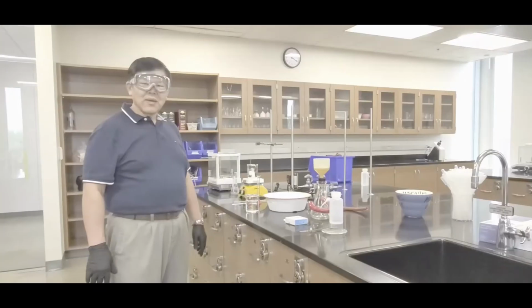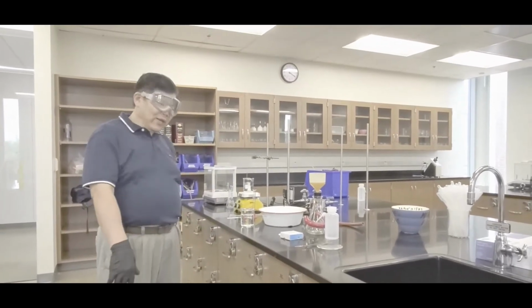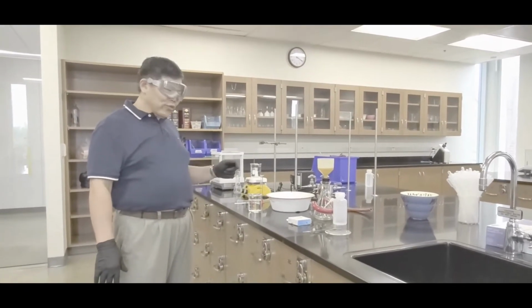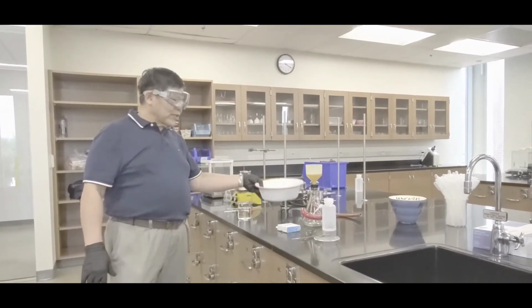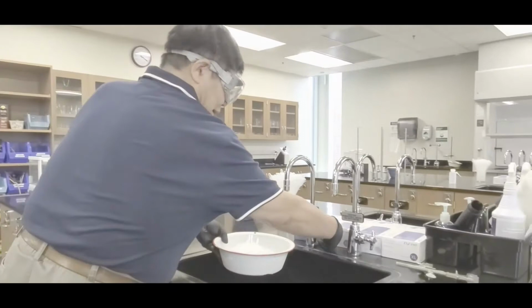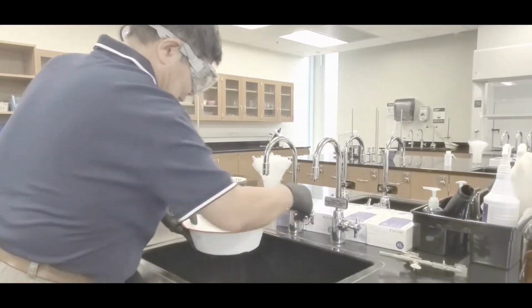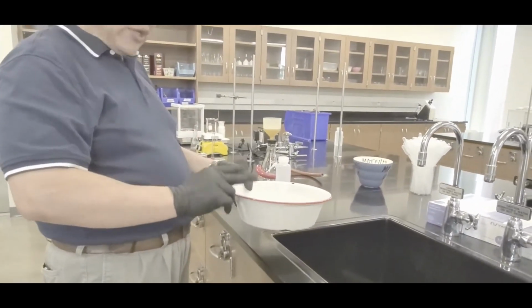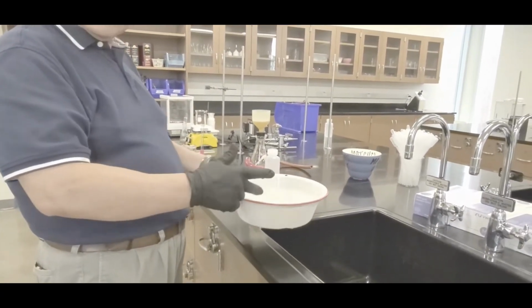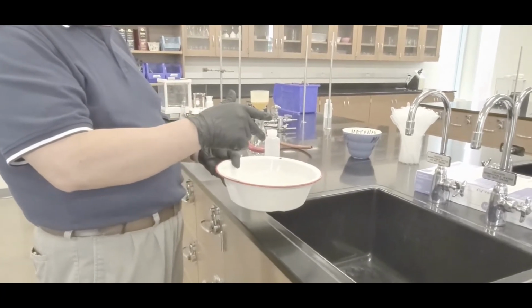Okay. All right, class. Now that you've gathered all the equipment that's necessary, what you want to do is this. The first thing you want to do, before you get the other stuff, is take that ice right there, go to the sink and put some water into it. Because what you want is to form a slush in there, an equilibrium, a coexistence of ice plus liquid water. In that case, this ice bath will maintain at 0 degrees Celsius.